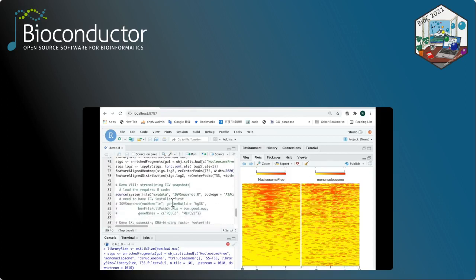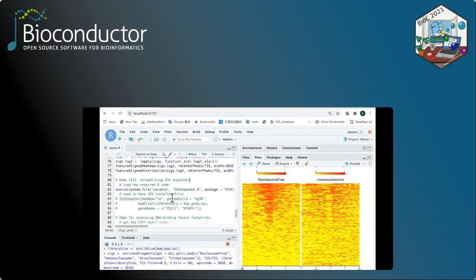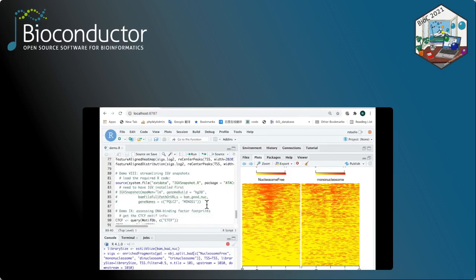And for demonstration 8, we're gonna leverage a function called ATACseqQC IGVSnapshot to streamline the IGV snapshots. And to run this command, you have to have IGV available. Because I don't have IGV available here in the RStudio, I commented this function out, but you can uncomment it and run it on your local computer.